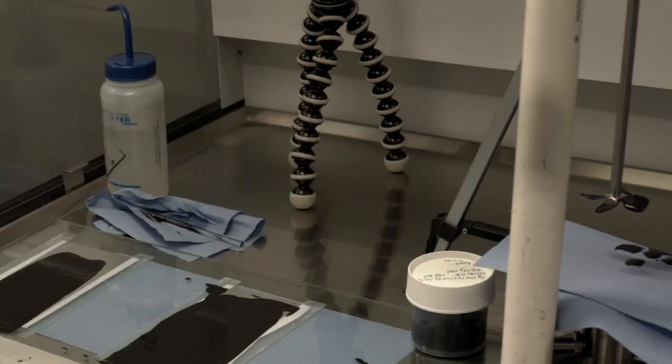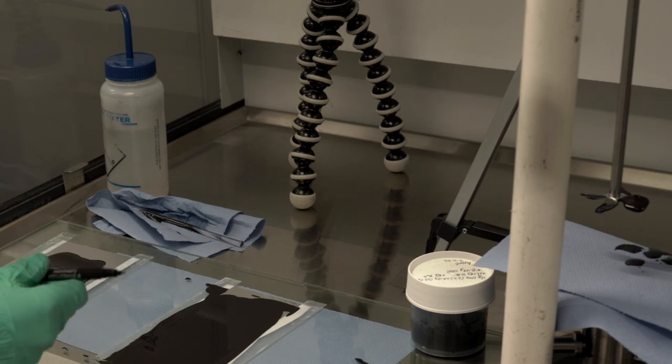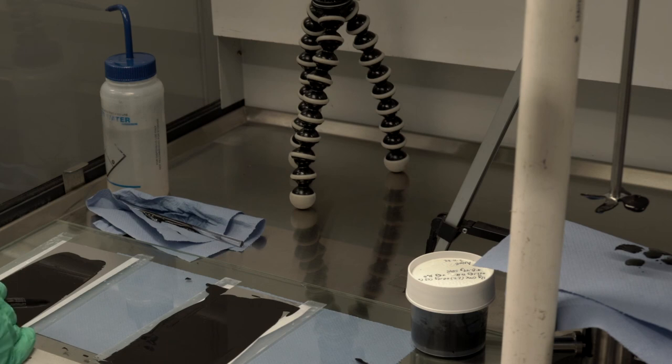I'll label those and I'll leave them to dry overnight because I want to dry them as slowly as possible to prevent separation, cracking, pinholes, and other mechanical defects that are often caused by a fast dry.